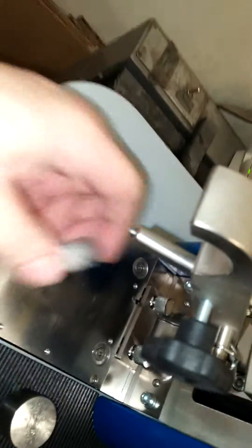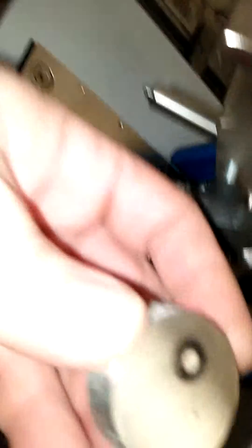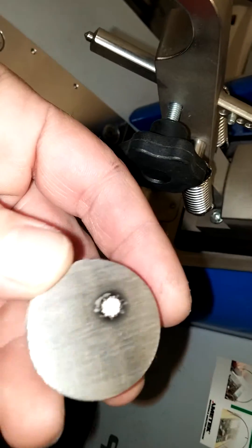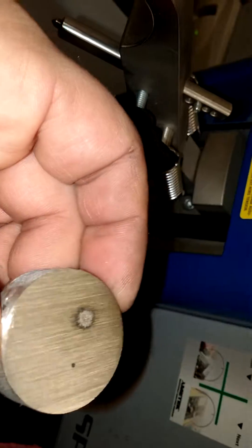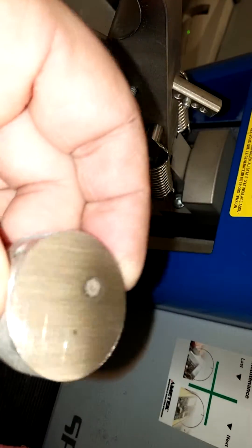So here it is. Take off the sample. There's the burn right there. Nice clean burn.